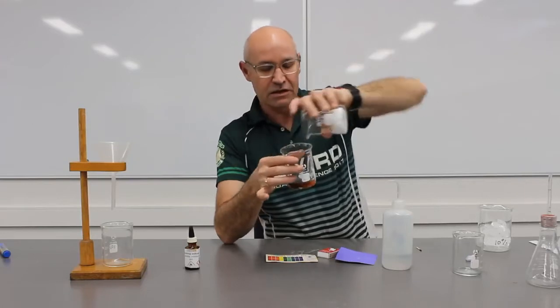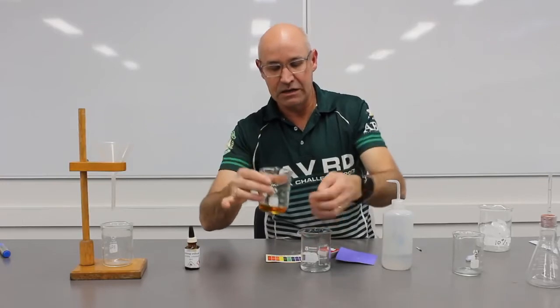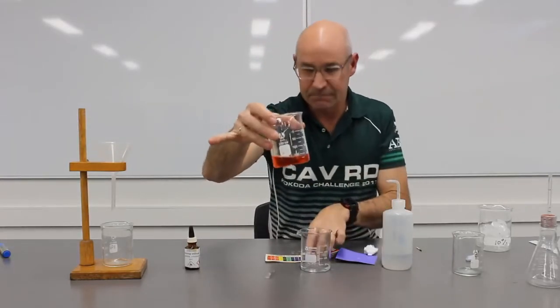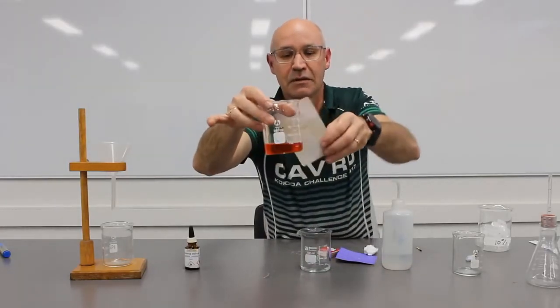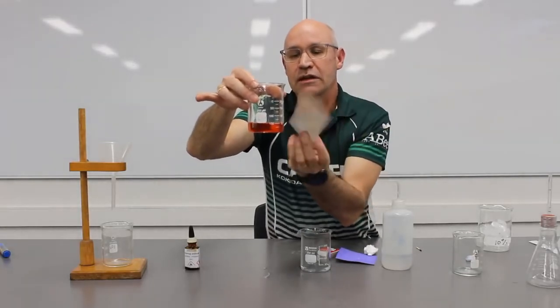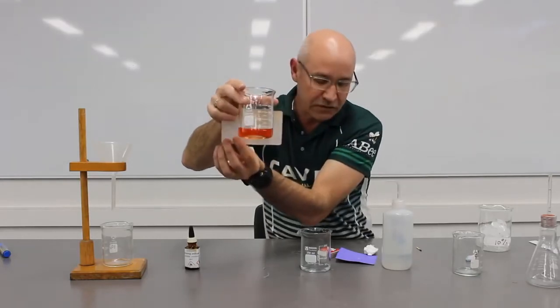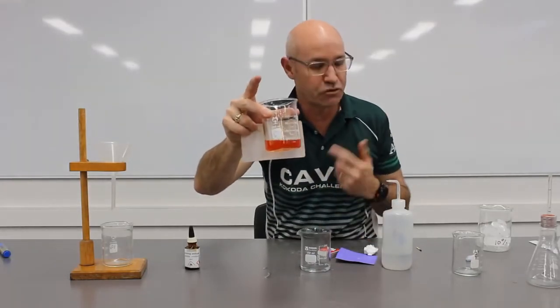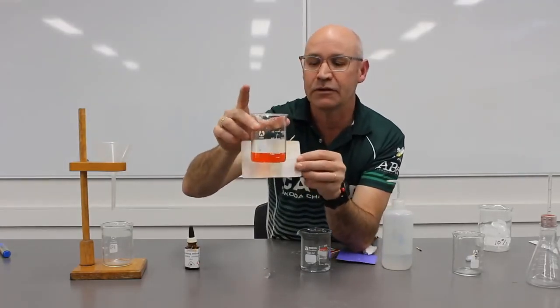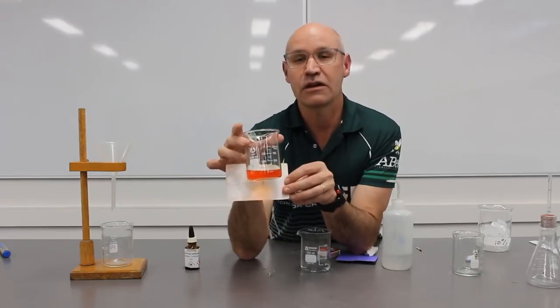And we can see that it has turned yellow, or maybe even red. A bit more of a squirt here, and it's actually turned red. So what does that mean? It means that we've turned the pH to around about pH 4, so it's orange or even red. And so the carbon dioxide that was produced by burning those matches has produced carbonic acid. And this is what happens with acid rain, and this is what happens with the acidification of the oceans.